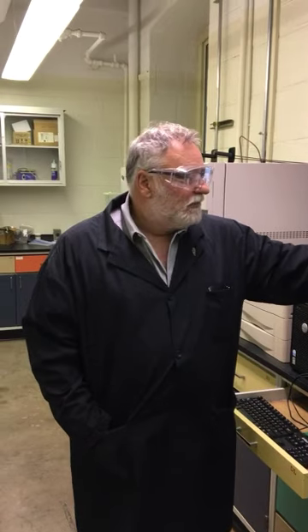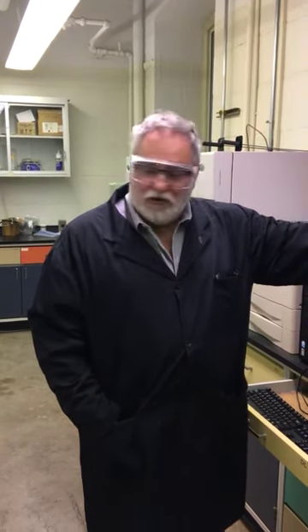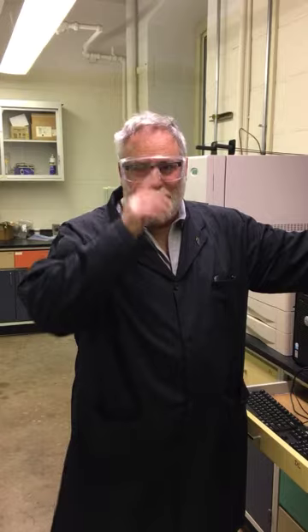So that was a very brief overview of what's done. Read the ASTMs, you can extract the useful information from that. The theory is how this instrument works. There's no discussion of any of the samples that we utilize in here. It's generic. You can say coal, but I don't need to know anything about the samples because that goes into the methods section. Do not confuse theory and methods.